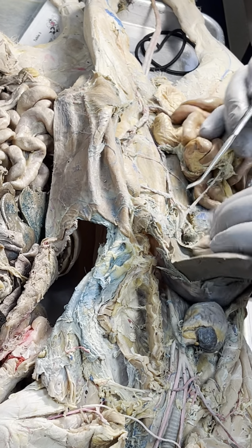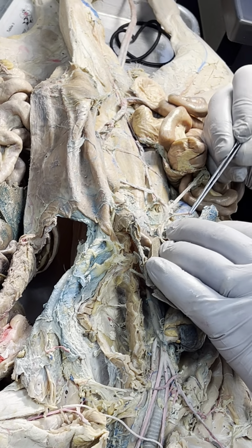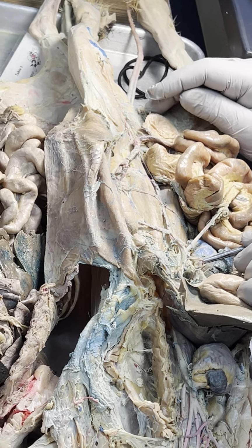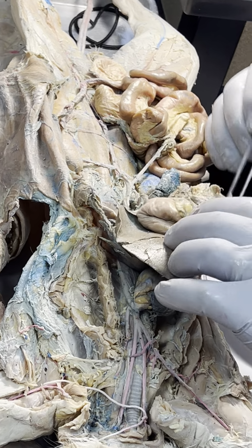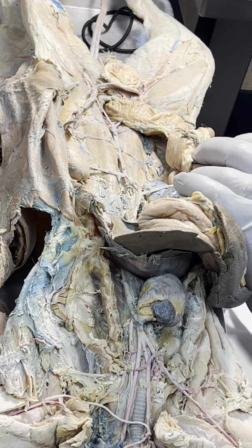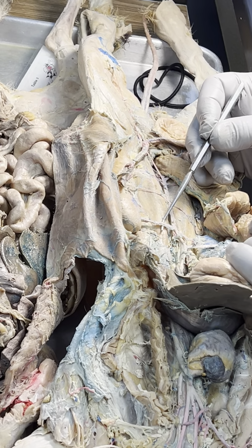So what happened to celiac trunk? Oh, there it is. It broke. See? It broke. So if you were going to name this by the numbers, you would have gotten that one wrong. The other half of this, it's up here somewhere. It came off of here. You don't care. So let's move on. Celiac trunk is broken in this cat. Don't worry, I'll show it to you on another cat. Superior mesenteric. So what's this one?